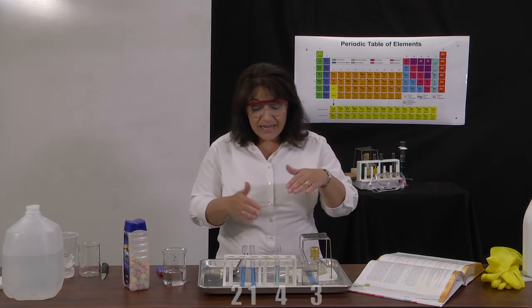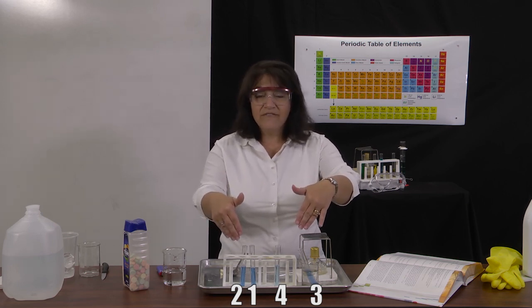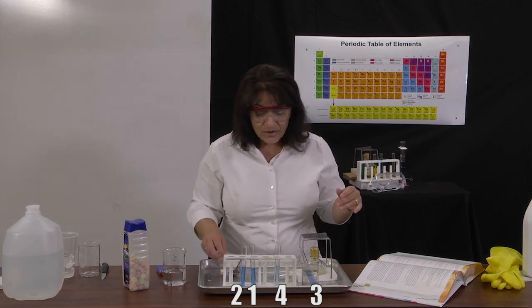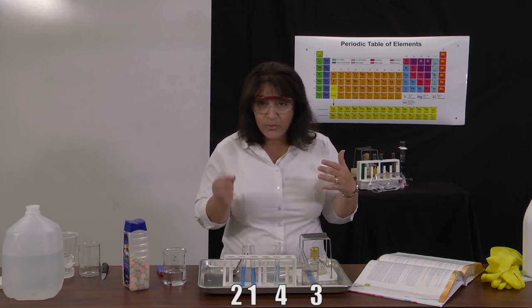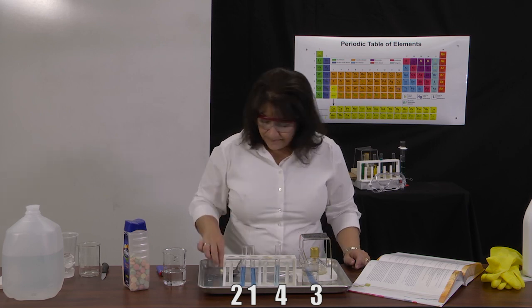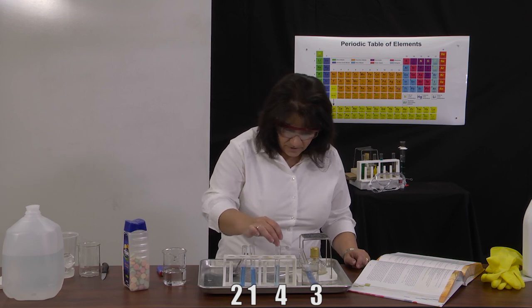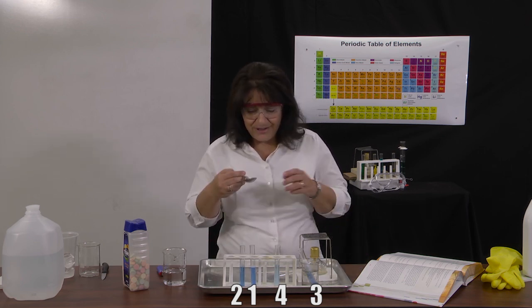That's ideal. Because I have mine in a test tube rack, I'm doing this so you can see all of them simultaneously. It makes it easier for you to see. So I'm not going to have to number mine because I'm going to know which ones they are. So 1, 3, and 4 are going to get regular or whole antacid tablets. This one's test tube 3, and this is 1, and this is 4 right here. Test tube 2, I'm going to put the powdered.